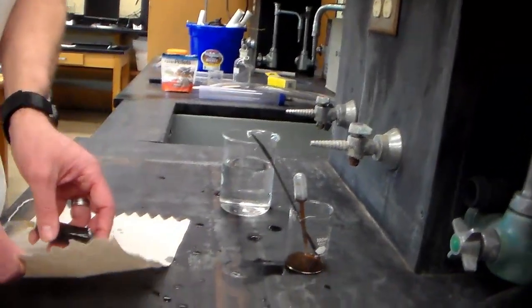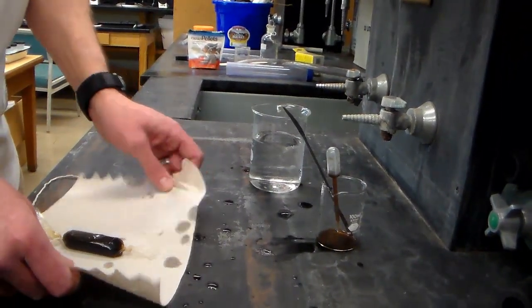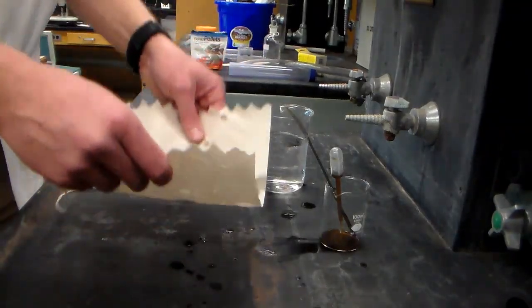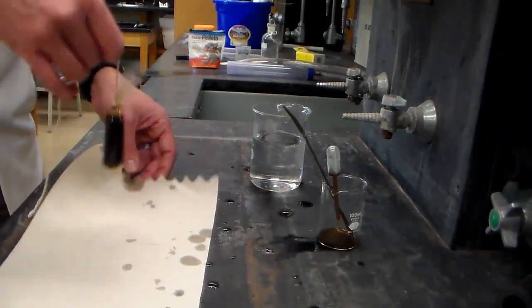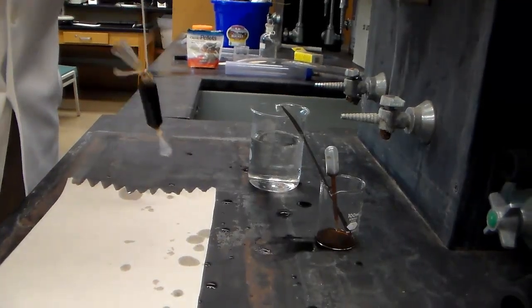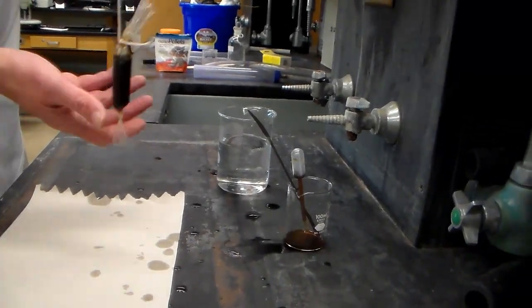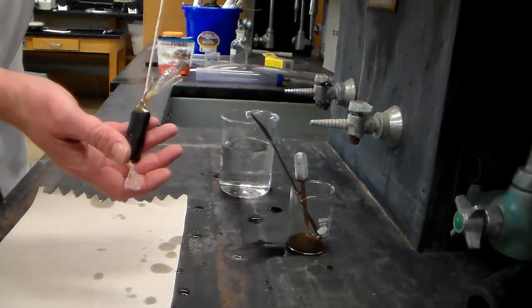Now we want to take a paper towel and blot it dry. Just roll it back and forth in your towel a little bit. And now our tubing is ready to go into our jar.